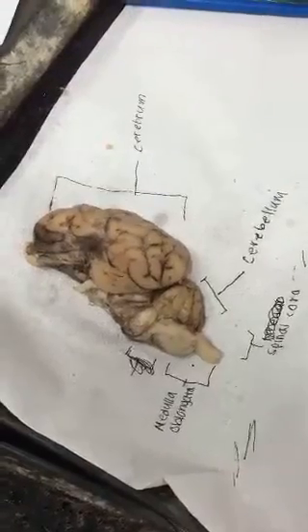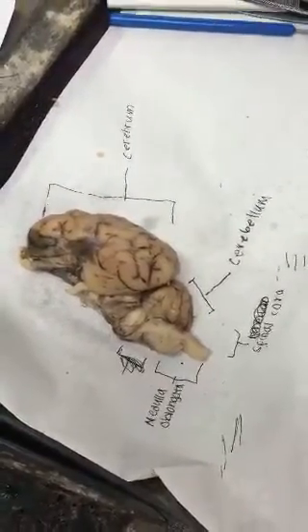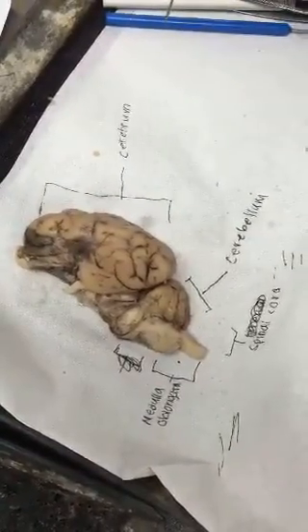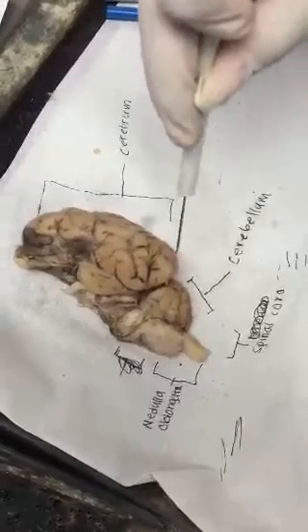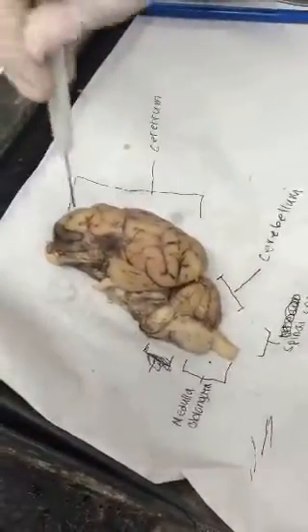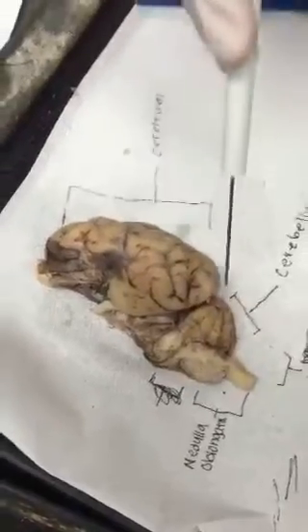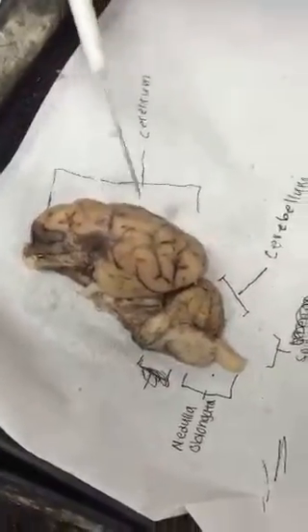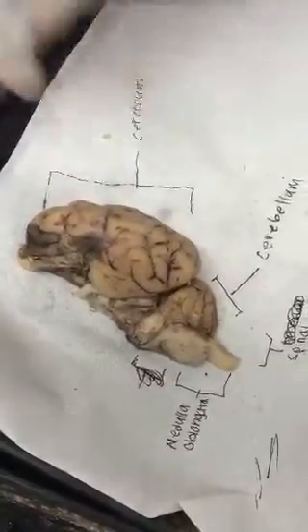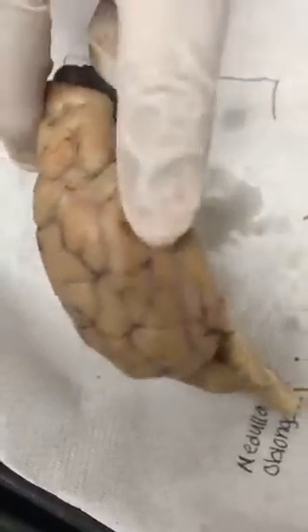This is the nervous system of the rat. First we have the cerebrum, which is this whole area. Then we have the gyri, which are the bumpy areas of the brain, so right here.